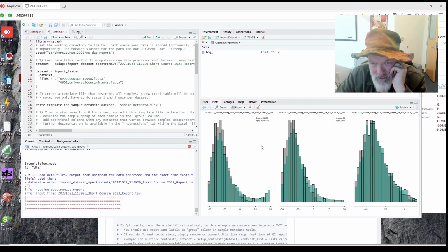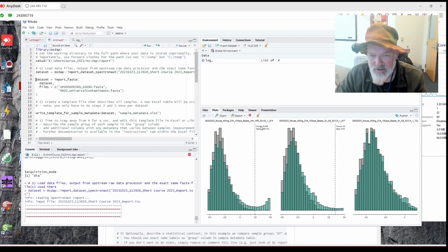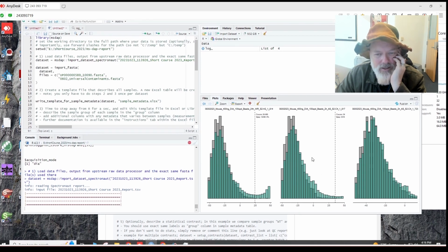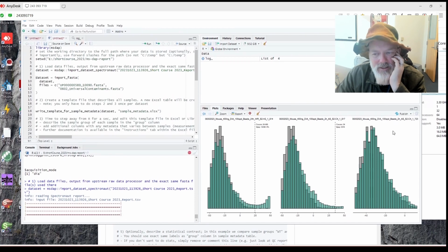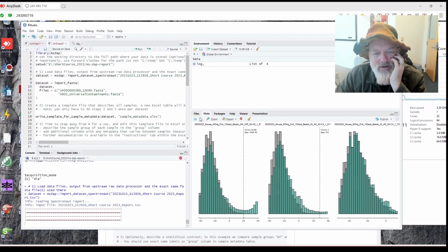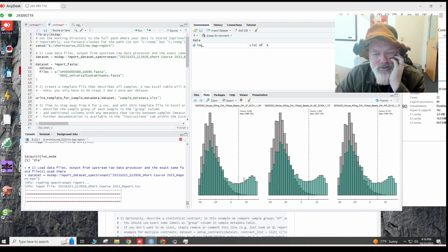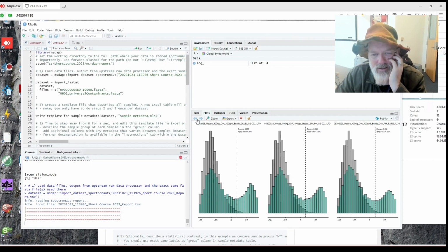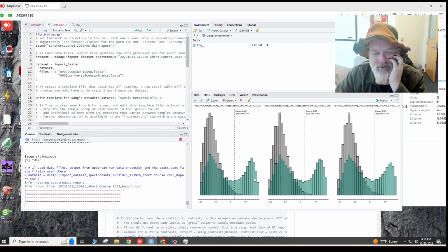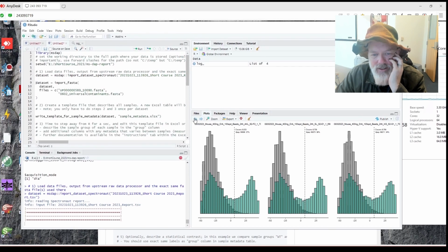It'll make these files again. You could see the distribution of the decoy and real data for the Spectronaut C-score. I think it does that for every file. There's a couple files in here that did not work, so maybe we can go back and try to see which ones didn't work. As you can imagine, there were a lot of things that didn't work. These look better just from the distribution alone. See how there's a little hump here? Yeah, that looks better. There were 2 or 3 files that were really bad. So this looks much better than that. You can see the distribution of the decoys versus the distribution of the real data. This is actually pretty useful.